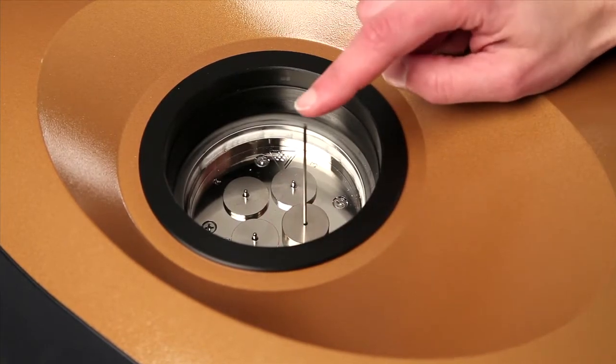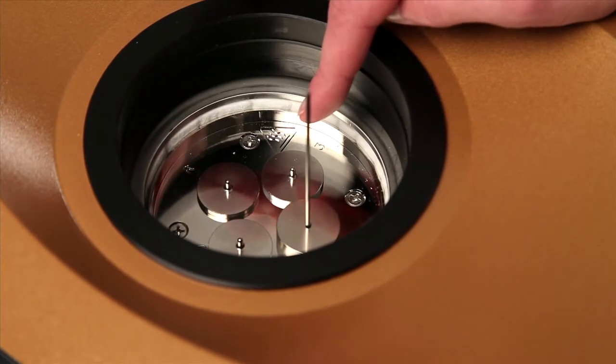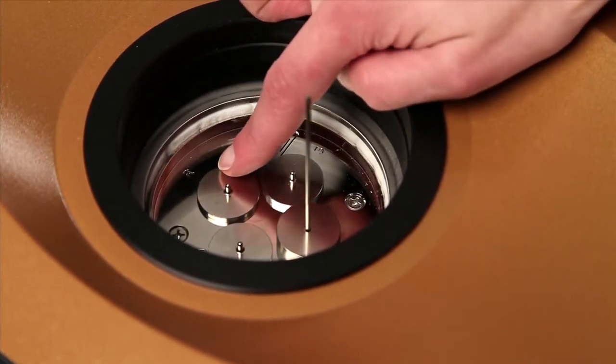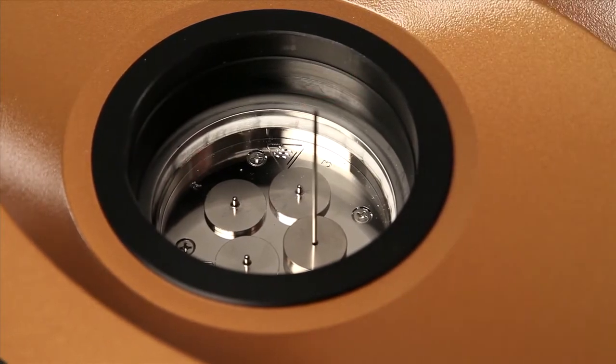There is an option to have the same batch assembly in the reference, or to have multiple batch assemblies. But in this case, we have a closed ampule in the reference, and then only one batch assembly loaded into the instrument.